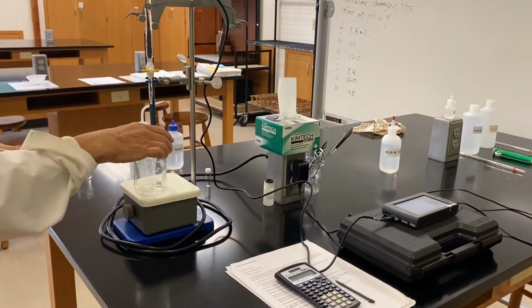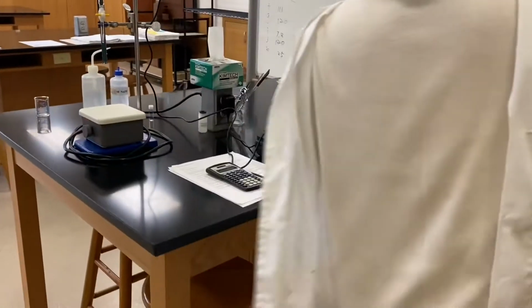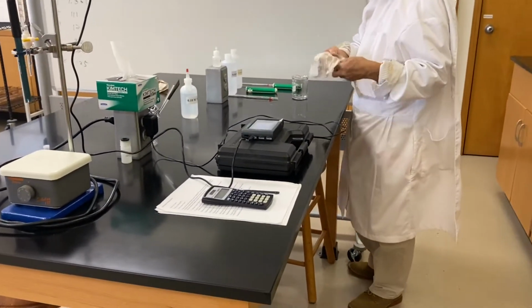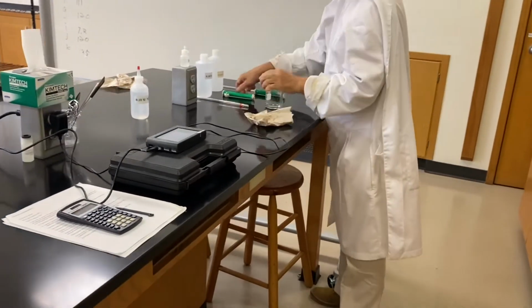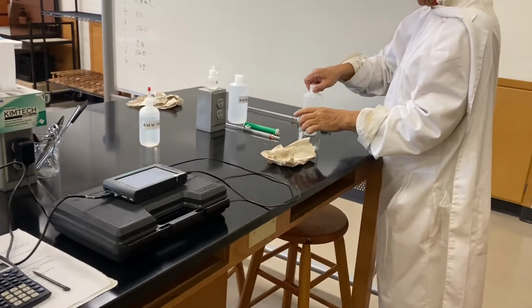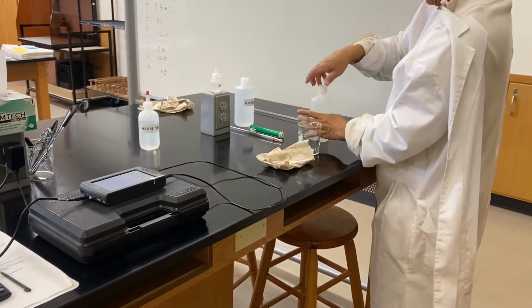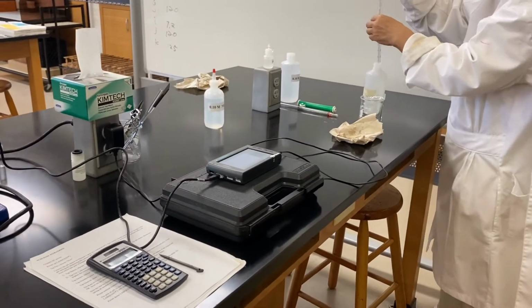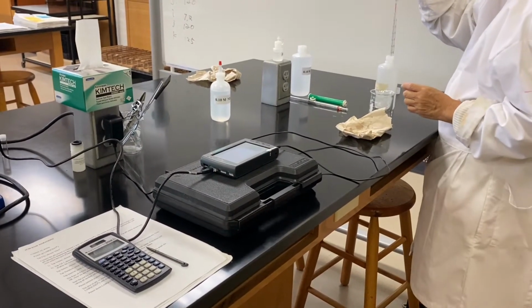Okay. So now, we're going to change from strong HCl to a weak acid, acetic acid.